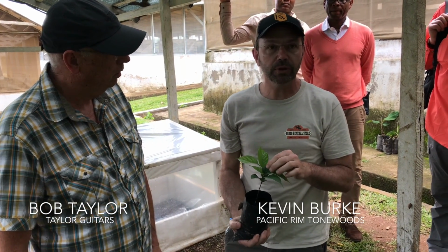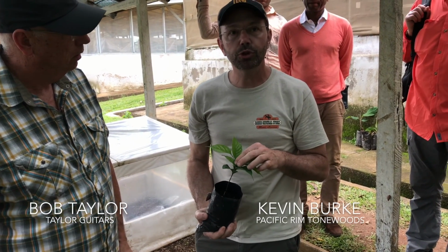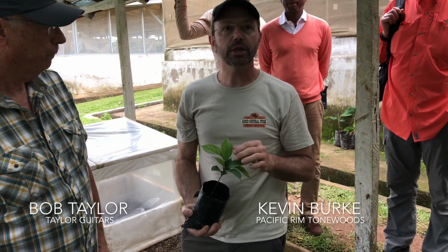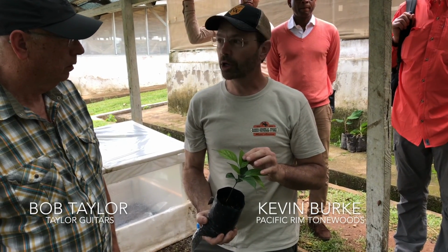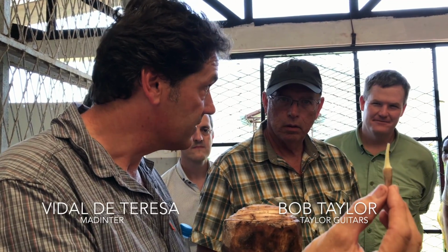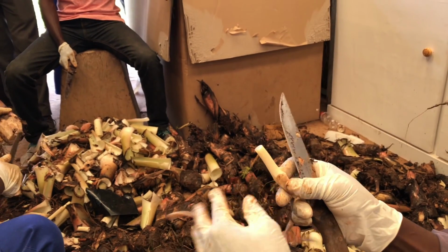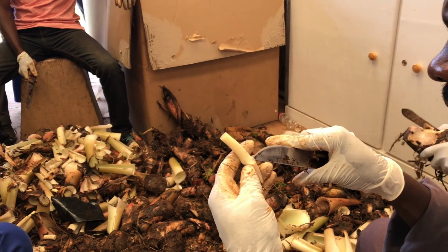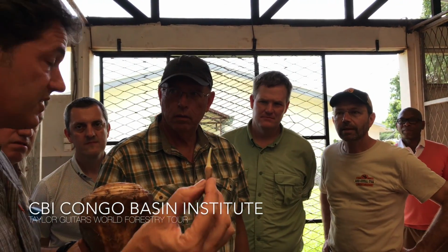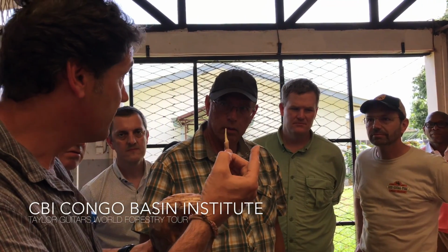But the only part that they can use, similar to all plant propagation, is the most juvenile material. It's the same challenge we have with Acer macrophyllum, the same challenge we have with Koa acacia. This small part, inside we have the meristem. So we are going to look for the meristem inside, and we are going to sterilize. When we have this piece sterilized, we will start the process that we saw before.